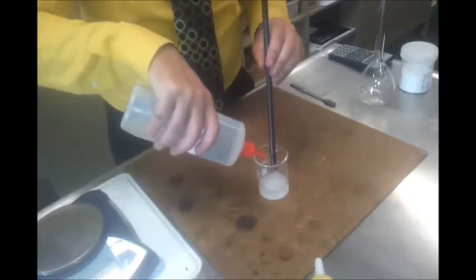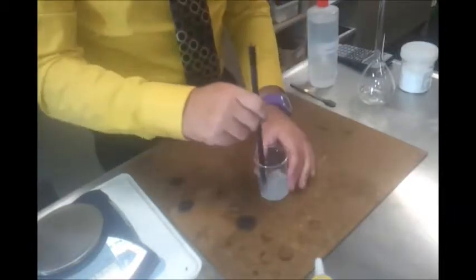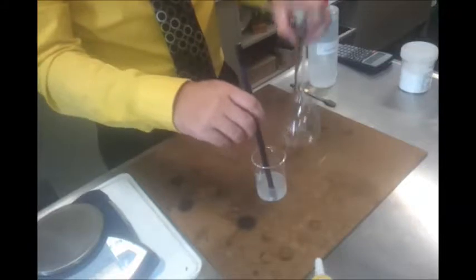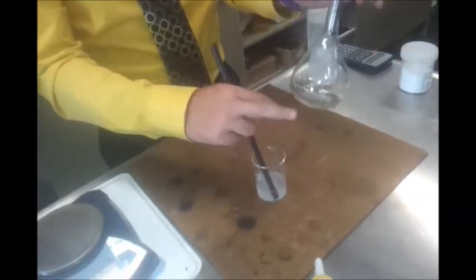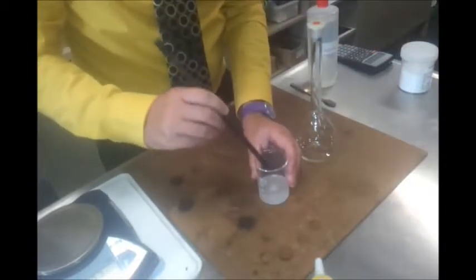Okay, and before we started I had rinsed out the flask as well. Now I don't actually want the solid bits to go into here. I only want them to go in once they're dissolved. The reason I do this is that if you try to mix it once it's in here, you'll still end up with solid on the bottom. It just doesn't happen fast enough. So I'm trying to get this done as well as I can.